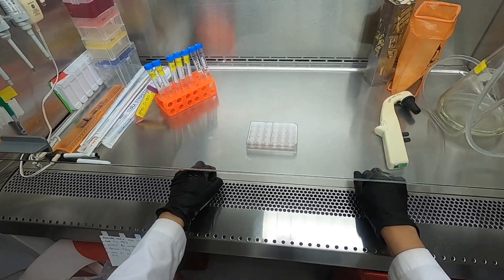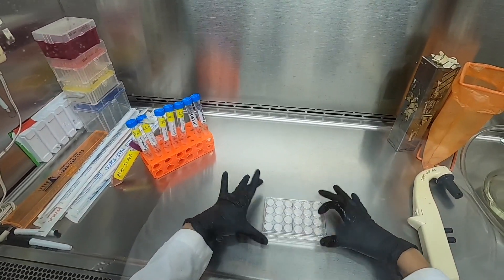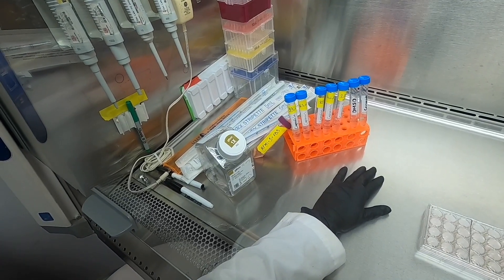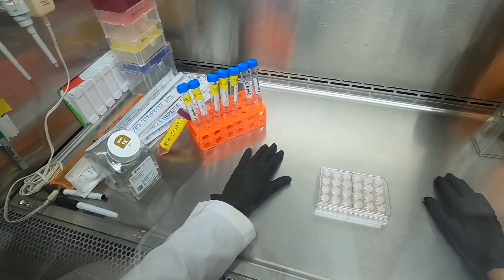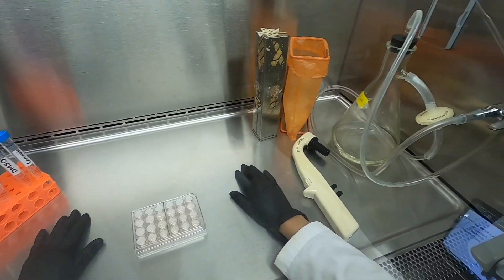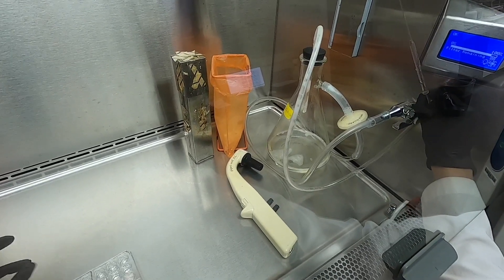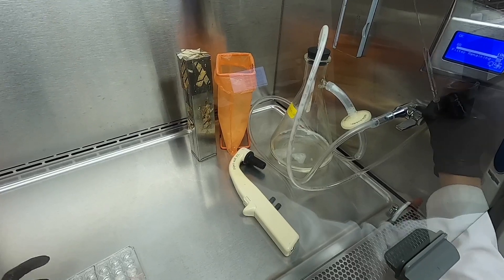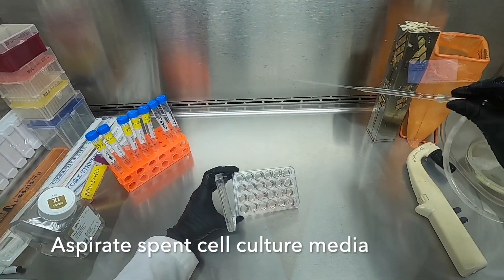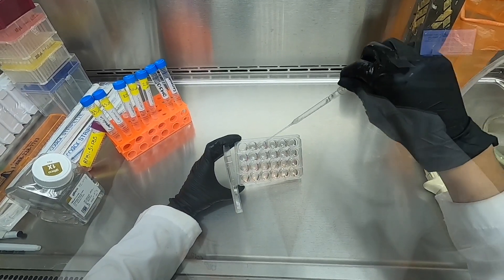This is because the volume for each of the wells is larger and therefore we will be using 5 ml pipettes instead of a multi-channel pipetter. Now we have all the materials we need including the cells and the compound dilutions.